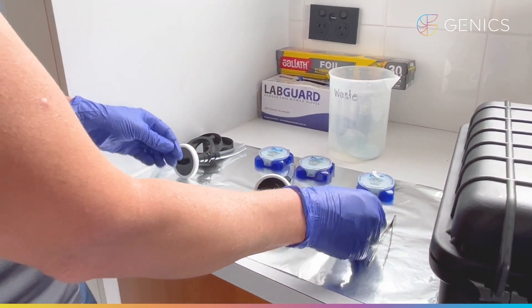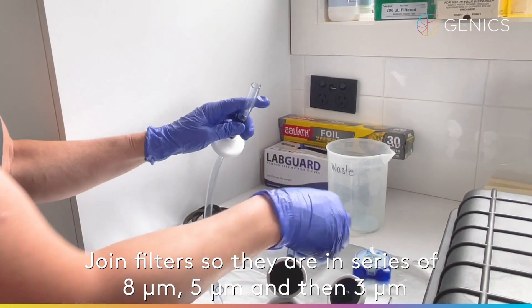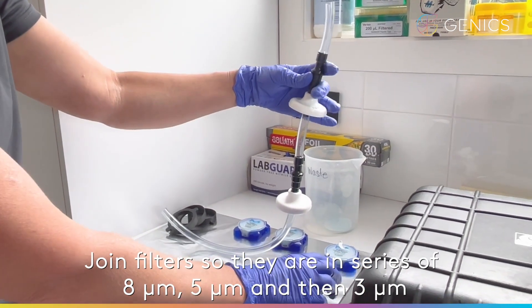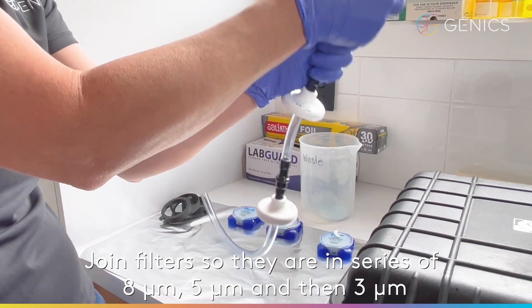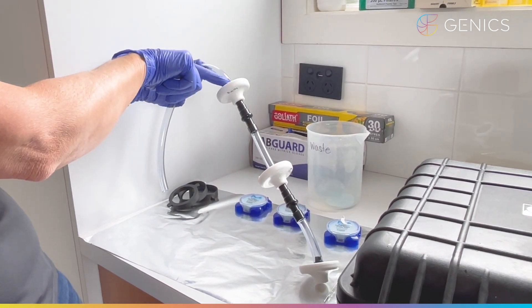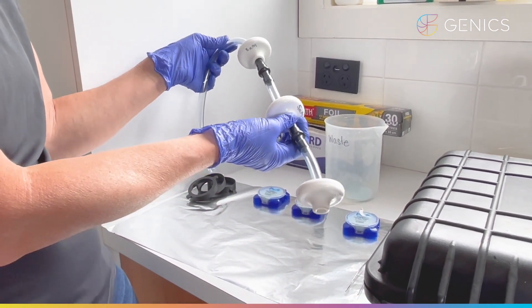So now in a line we want to set this up so water comes in through our intake, through our eight micron filter, through our five micron filter — keeping this on our foil here which is a sterile surface — and then through our three micron filter. Taking note that the water we have is intake water, with the filter paper and the cartridge housing labelled accordingly.